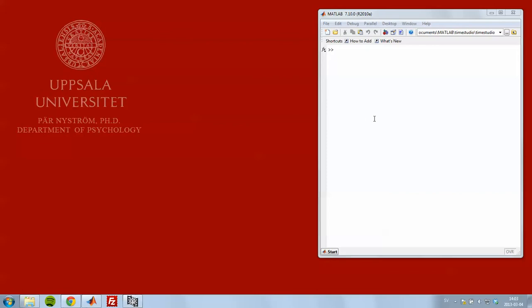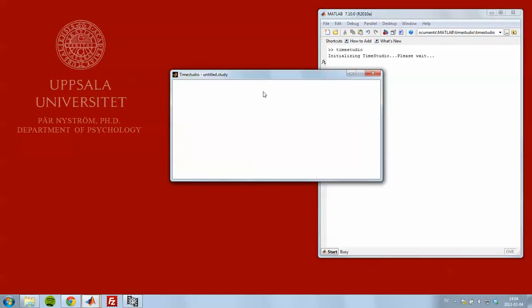This is a TimeStudio tutorial on how to perform a timing test to see if your eye tracker is presenting the stimuli at the right time. So I start by starting TimeStudio to bring up the main window.